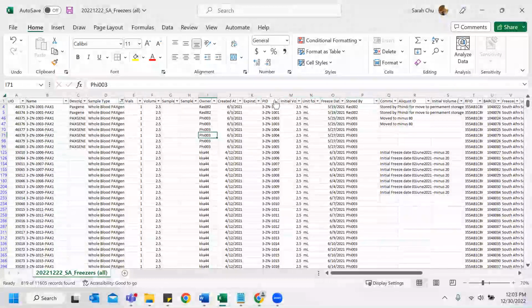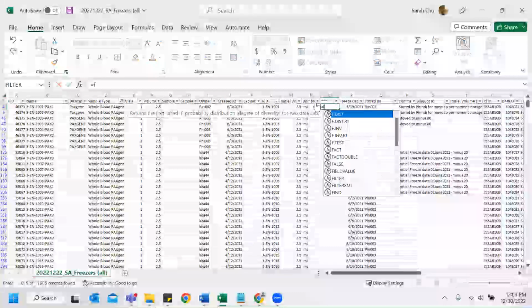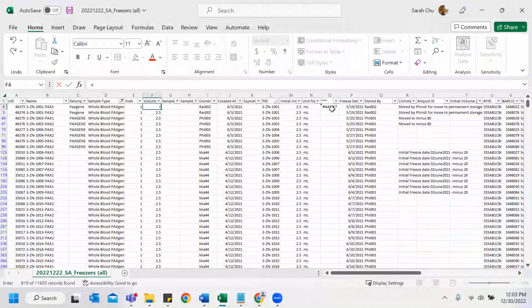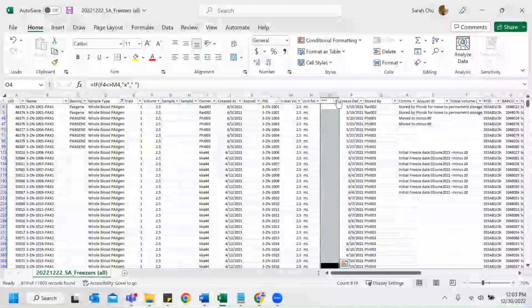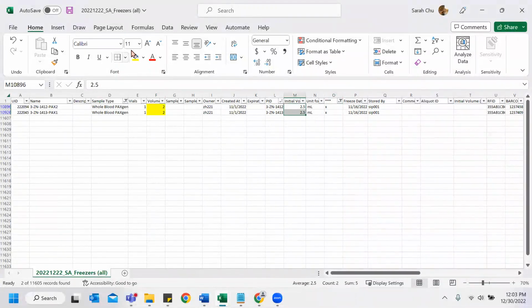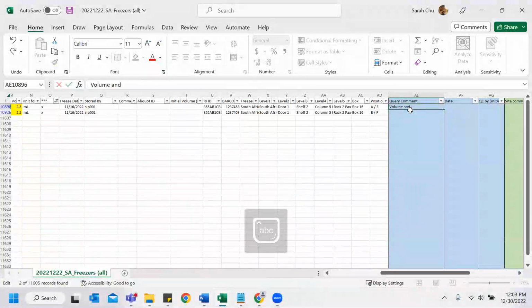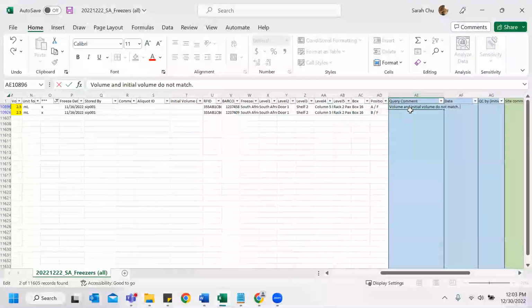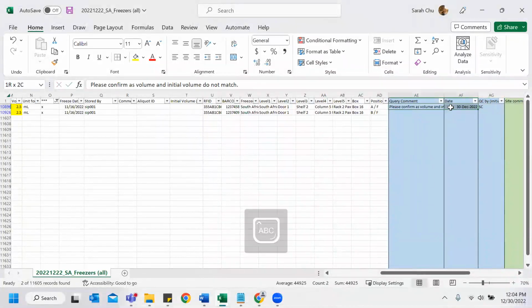So we're going to do the same thing. Confirm volumes. Just do it here. Volume greater than, oh, you drag it. Okay, there's an X. I would highlight it and say, 30, same thing.